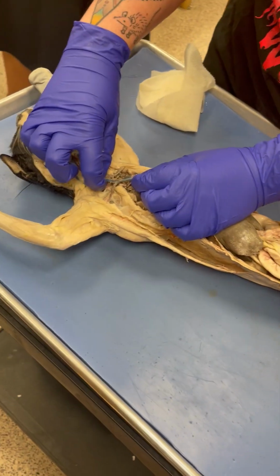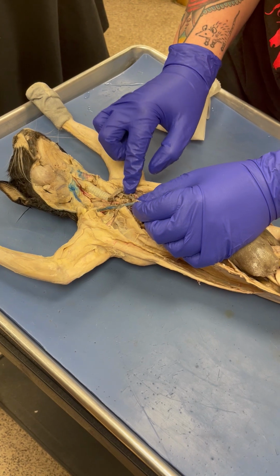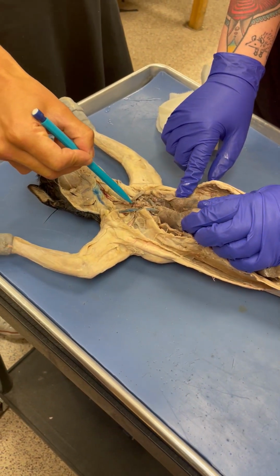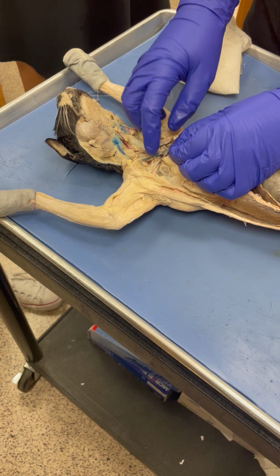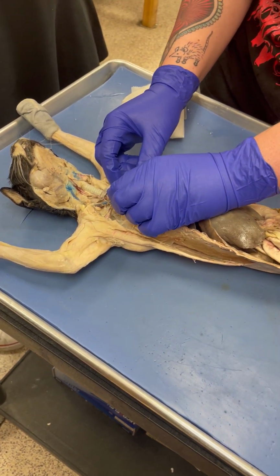That splits into jugular and subclavian, and it does that on both sides. And are you going to ask about the lymphatic duct right here? Are you going to ask anything about that? If I put a pin there, yeah. So this is the right lymphatic duct draining here, and the thoracic duct drains at that junction there.